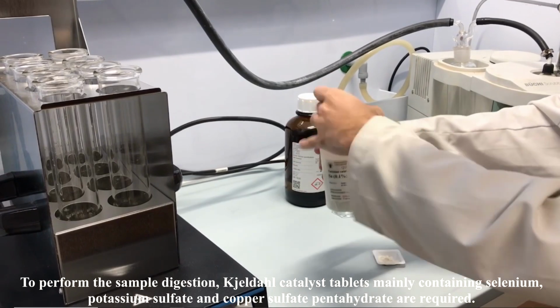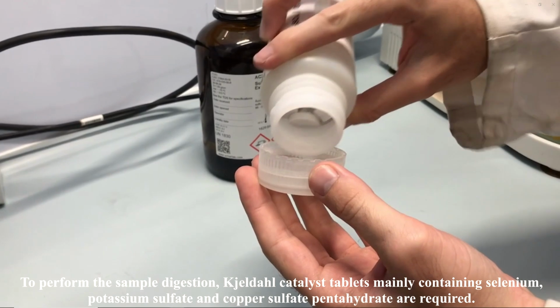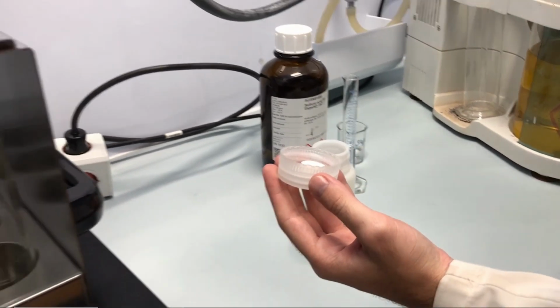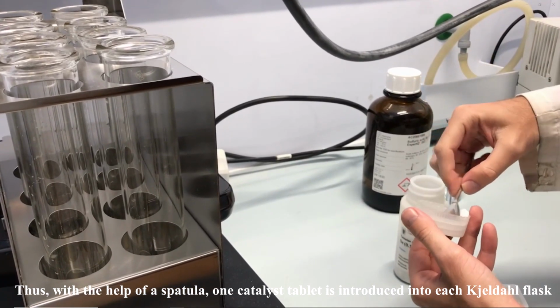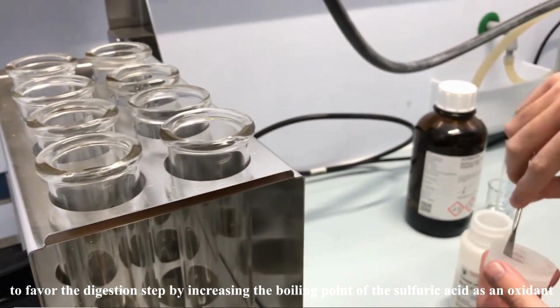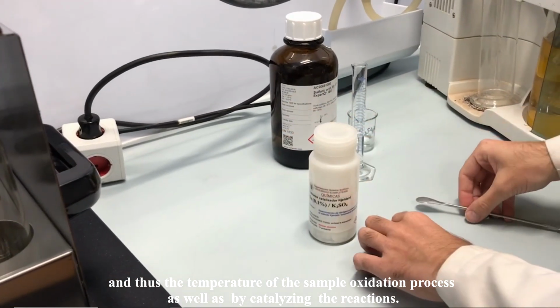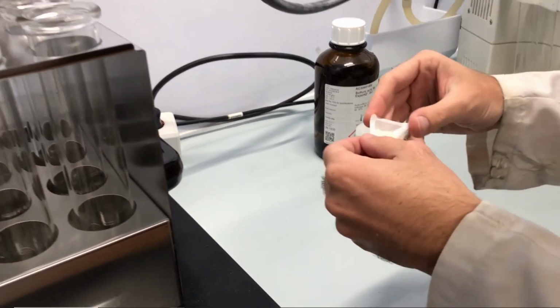To perform the sample digestion, Kjeldahl catalyst tablets, mainly containing selenium, potassium sulfate, and copper sulfate pentahydrate, are required. Thus, with the help of a spatula, 1 catalyst tablet is introduced into each Kjeldahl flask to favor the digestion step by increasing the boiling point of the sulfuric acid as an oxidant and thus the temperature of the sample oxidation process, as well as by catalyzing the reactions.